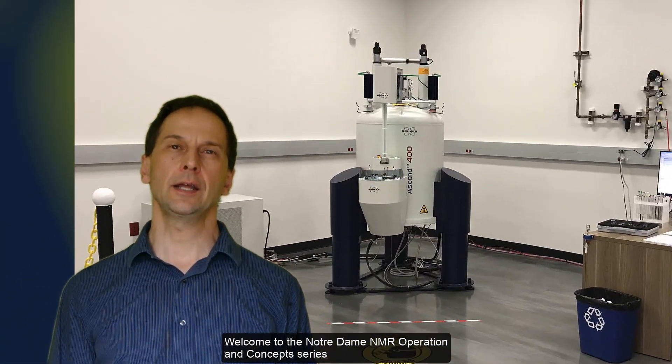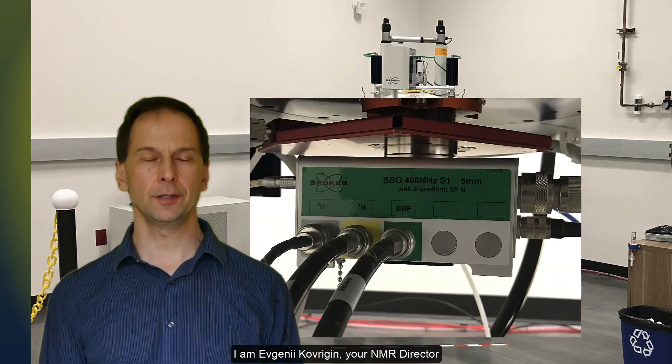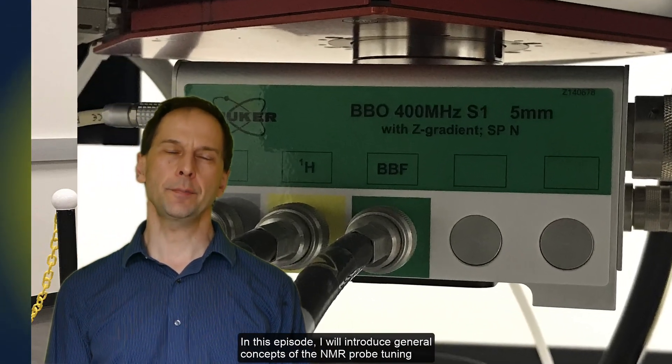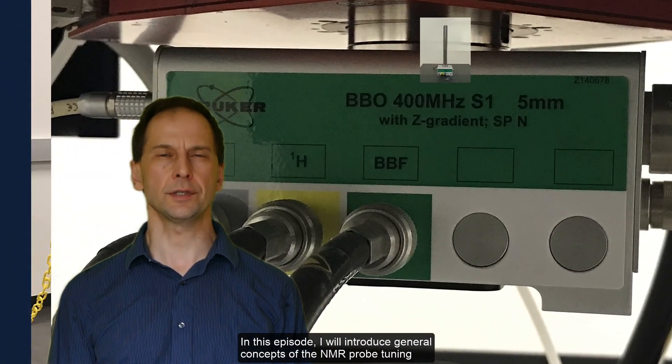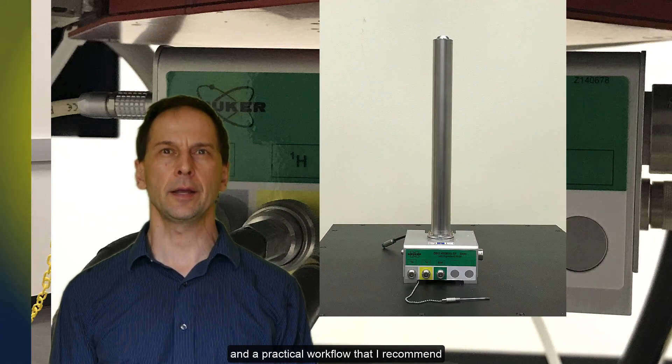Welcome to the Notre Dame NMR operation and concept series. I am Evgeny Kovrigin, your NMR director. In this episode I will cover general concepts of NMR probe tuning and the practical workflow that I recommend.